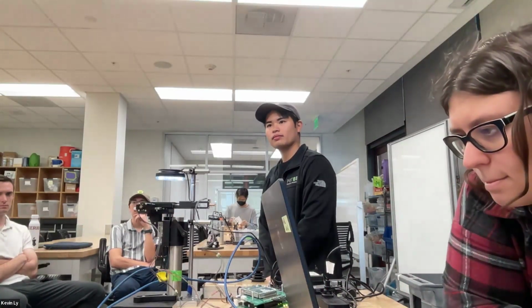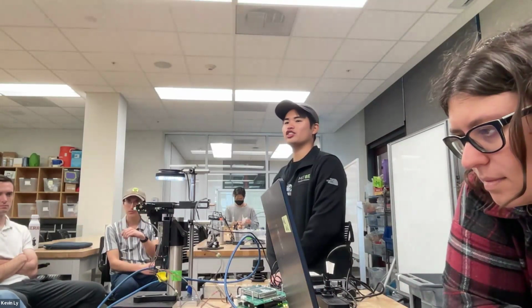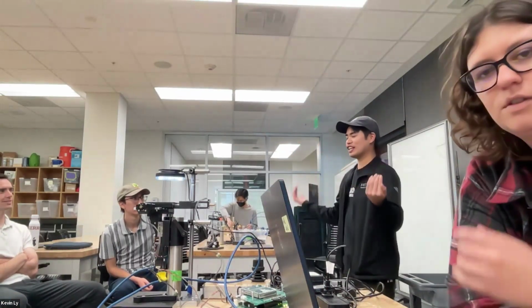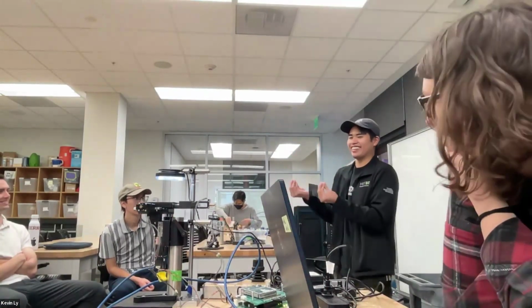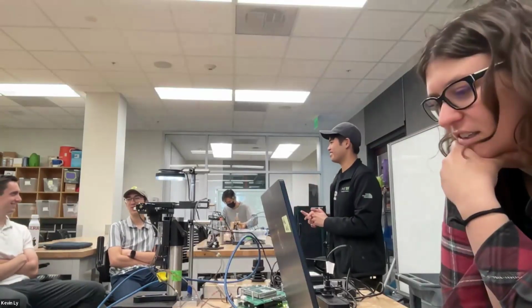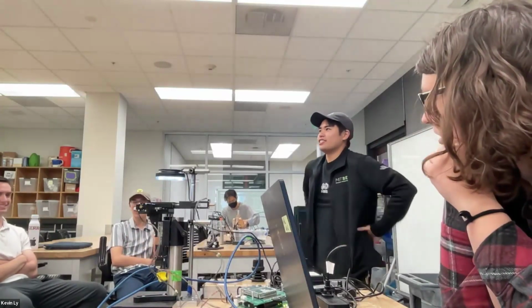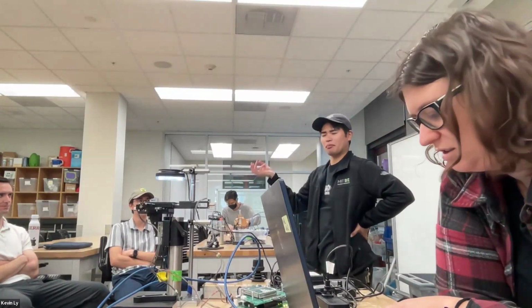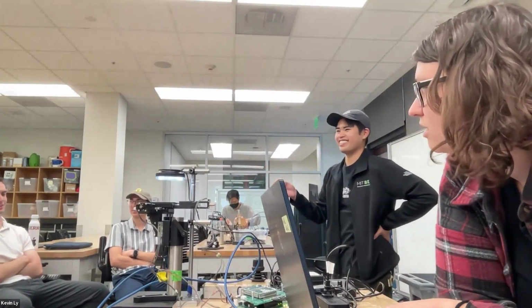Can you explain that gold piece he was talking about and how that lets you focus? So do people know what a piezo is? Okay, yeah. It's not in the common knowledge of a layperson. I sort of know what it is, but not really. So maybe you know the root of it. It means like pressure or something. No, I don't. I'm only in the marine space.